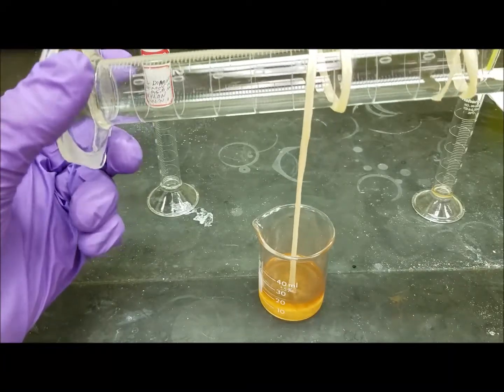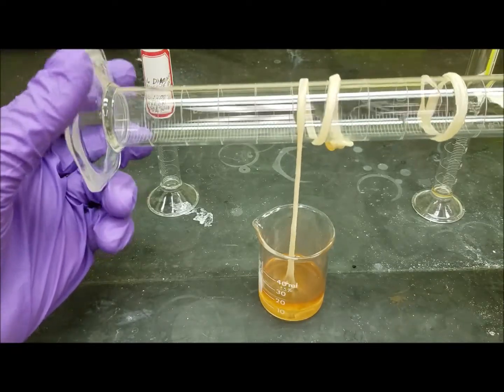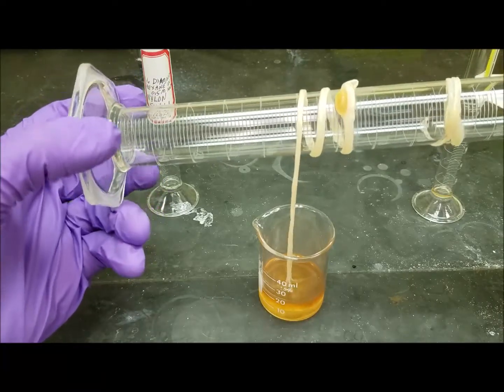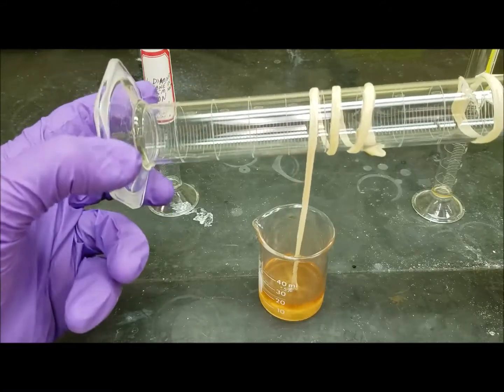So notice this reaction just keeps on producing the polymer as I remove some more forms. So you can think about this sort of like an equilibrium reaction.